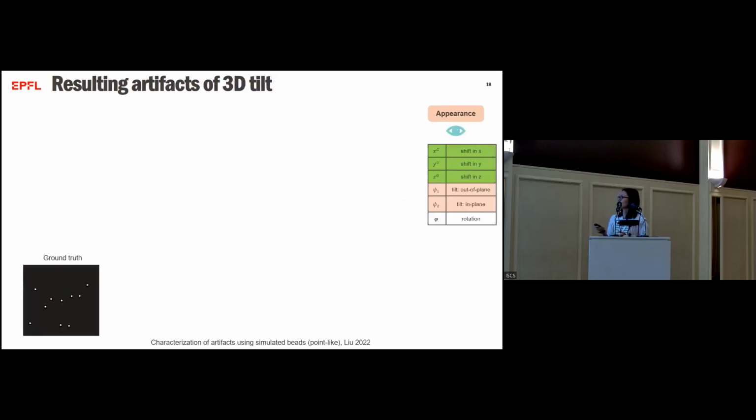So now we focus on 3D tilt, because it has not been seen in the literature yet. To characterize 3D tilt, we simulated some point-like objects, beads, to characterize the system. Our volume is a stack of 512 slices, and we chose 3 representative slices to show you the reconstruction results and compare to observe artifacts.